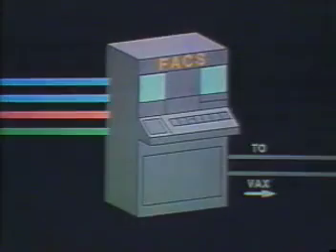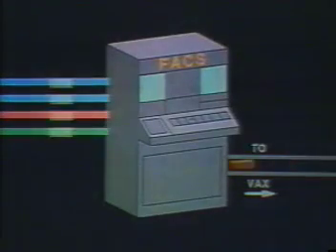While the oscilloscope monitors data from 2 of the 4 FACS sensors Keith is using, all 4 digitized sensor readings travel to FACS Desk through a special hardware interface that connects the FACS directly to a VAX computer.